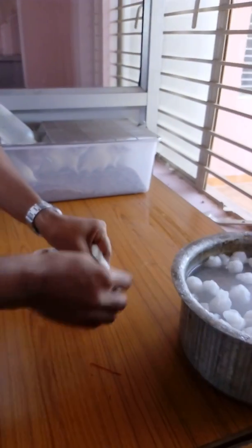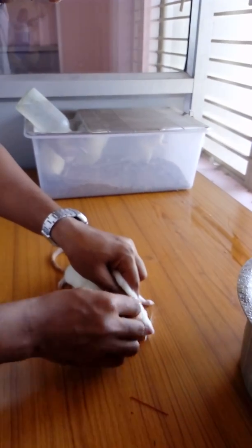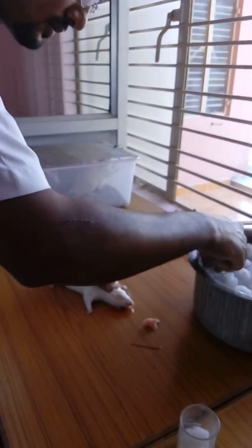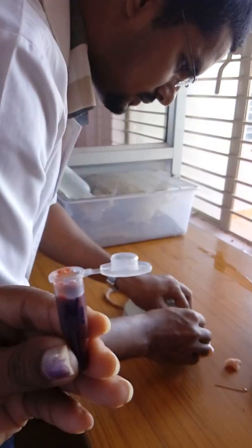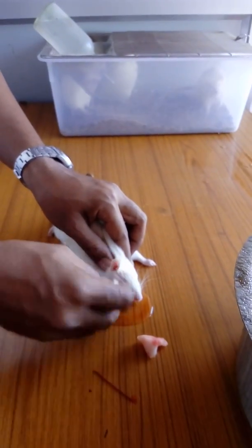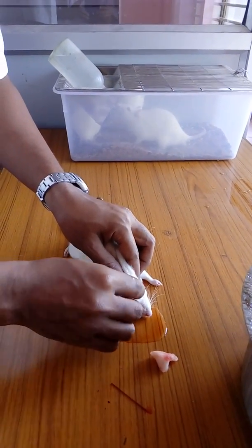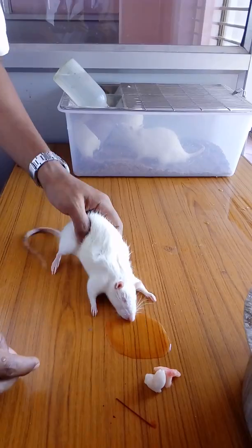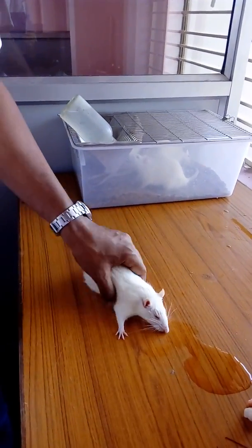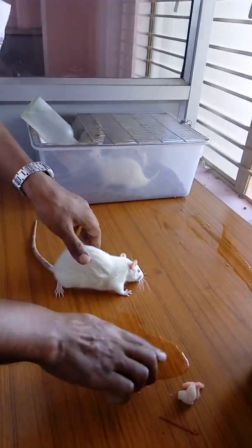Now we put cold water on the site so that the bleeding will stop. The rat is not dead. As mentioned, with cardiac puncture you must kill the rat, but with retroorbital collection you do not. After some time the rat will recover, and we can place it in fresh air so it can breathe.